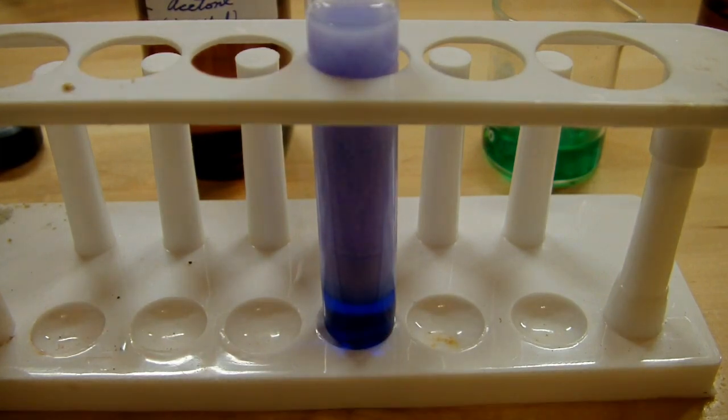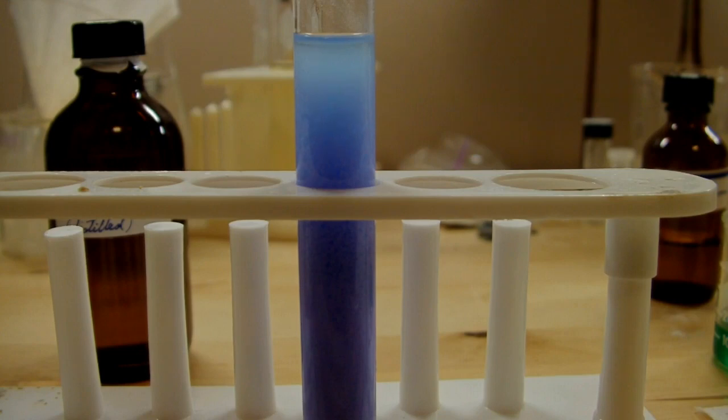Now you can really see the purple color. So I'll keep on adding acetone and then give it a minute to let it settle. We're most of the way through the addition now. And you can see there's quite a difference between the color of the solution from when it started. It's a much paler blue and the precipitate is very definitely a lavender color. It's very compact, too. You see it settles quite quickly, which is nice.